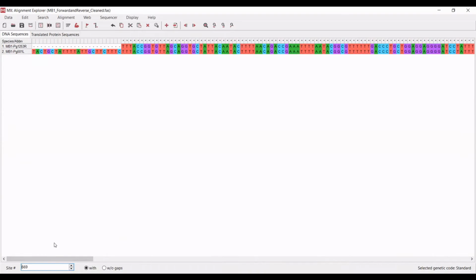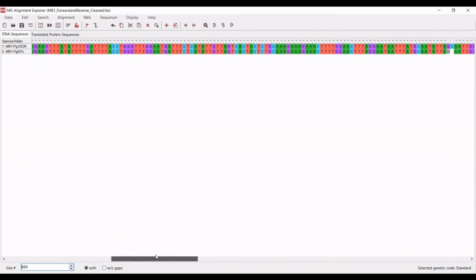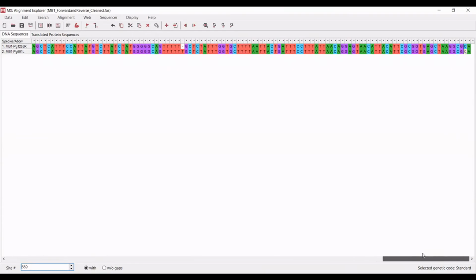Okay, so you can see here that as you scroll through, yeah, the sequences match, which is great. That's what you want to see. This is where you can look at differences in alleles. For instance, there's this difference here. There seems to be a deletion in the reverse sequence, but not in the forward.